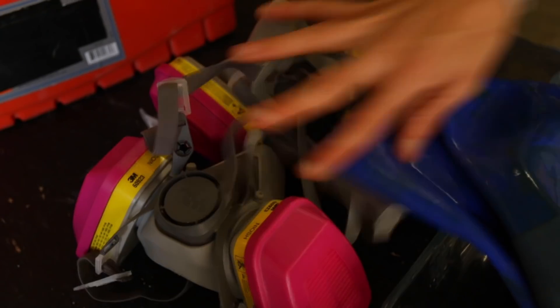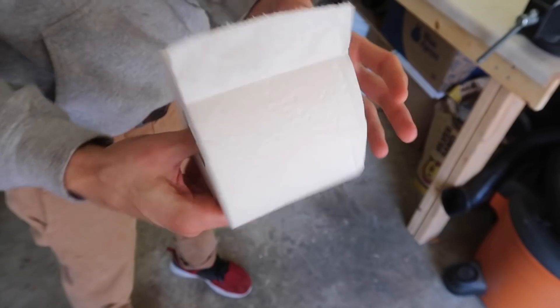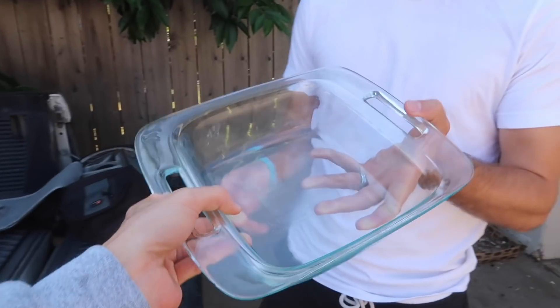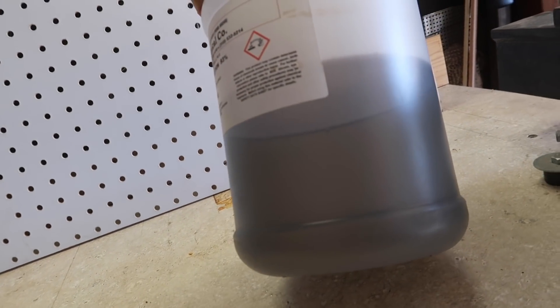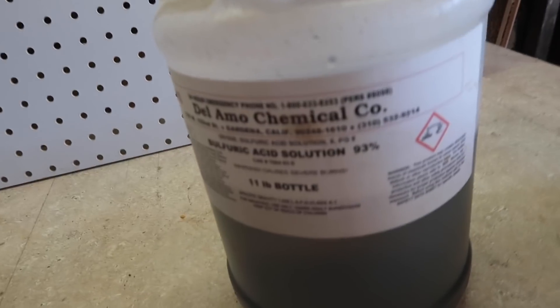For the first step I really just want to show you how destructive sulfuric acid is by itself. The first item we're going to put it on is toilet paper. Girlfriend does not like when I use the dishware, but you know, science calls. I've never seen the sulfuric acid do this, but it's like this dark color. I assume that's because it's been oxidizing in there. I don't know why it's that dark color — maybe it just stained the bottle. If there's any sulfuric acid chemist, LMK. It's 93 percent — it's the good stuff.